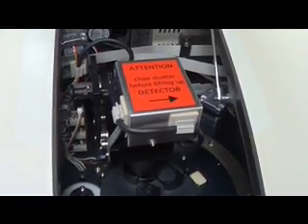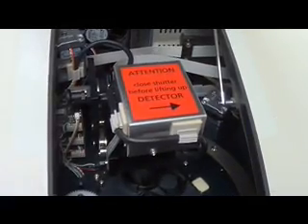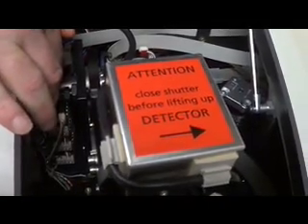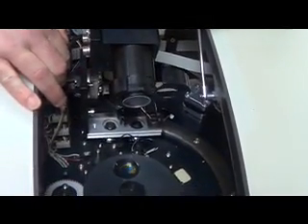After you've positioned the cutout parallel to the PMT, you can now pull the knob on the left hand side. Once that is pulled, you can grab the PMT and it will come up and click into place.